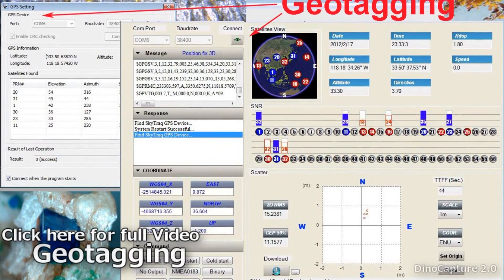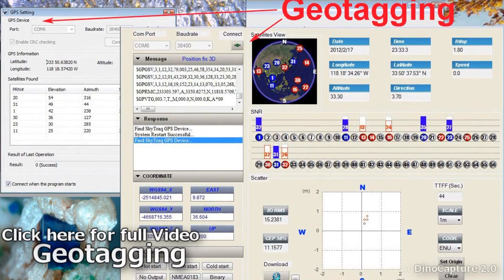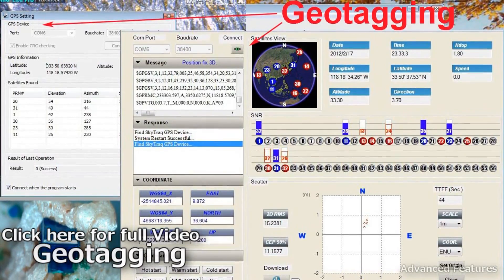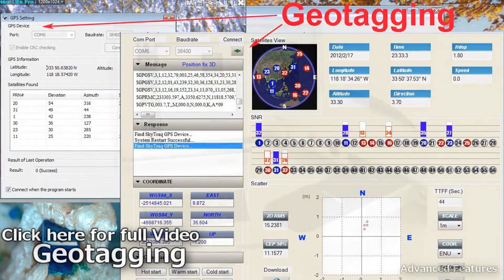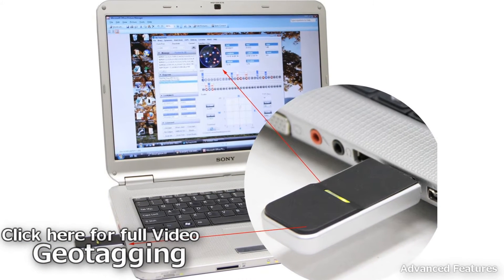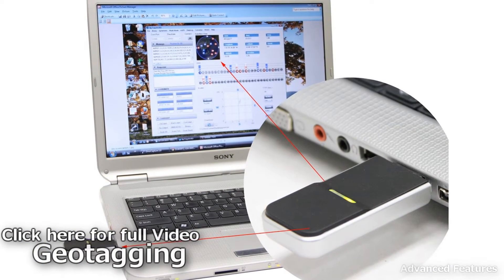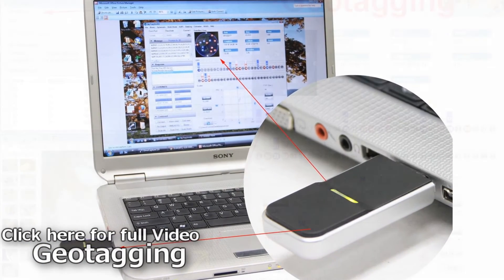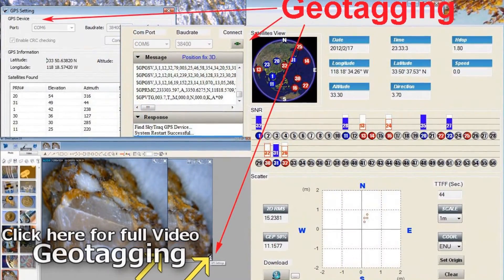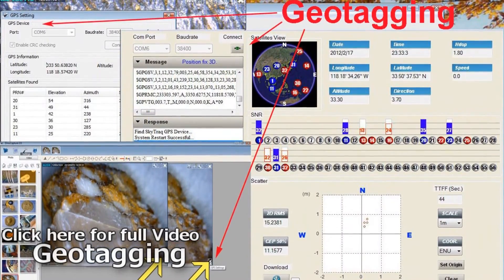Geotagging allows users to add geographical identification metadata to captured images or video by attaching an additional GPS device to your computer. Geotagging can help users find a wide variety of location-specific information, and can be very useful for cataloging a library of photo images for research or other purposes.